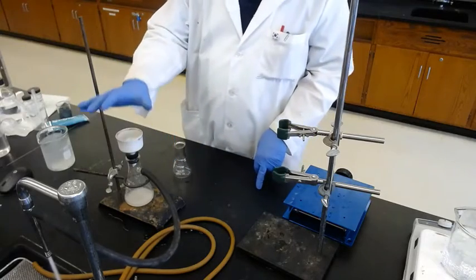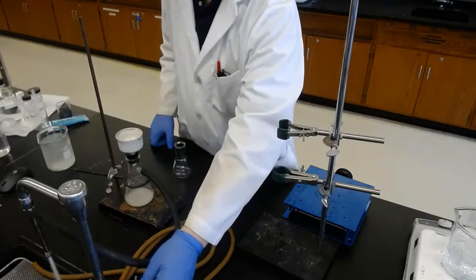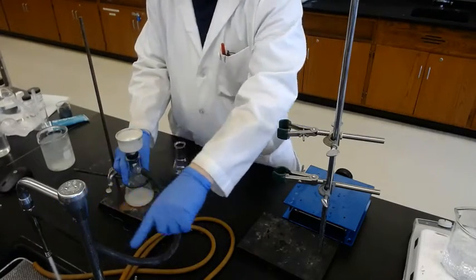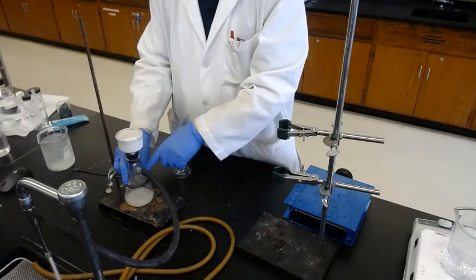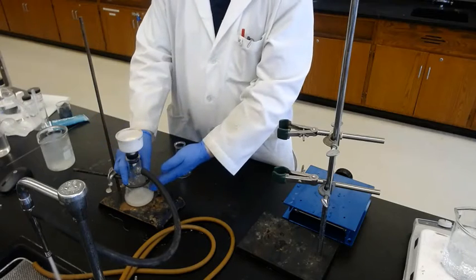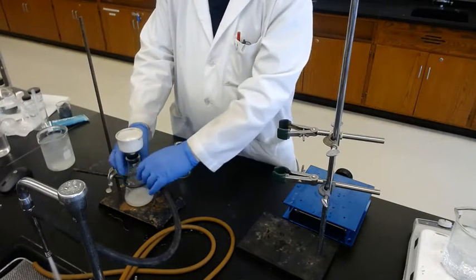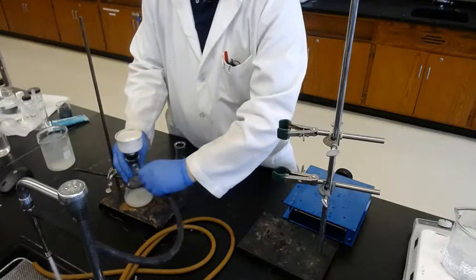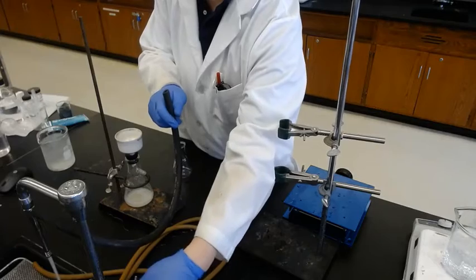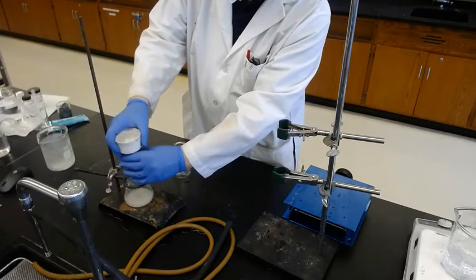Okay. When you finish the vacuum filtration, don't turn off the water first. If you turn off the water while the flask is on the vacuum, water flows back into the flask. Today it is okay because our product is a solid, not a liquid. But it's better to have the habit. Don't turn off the water first. Release the vacuum first, and then turn it off. That's the correct way. Okay.